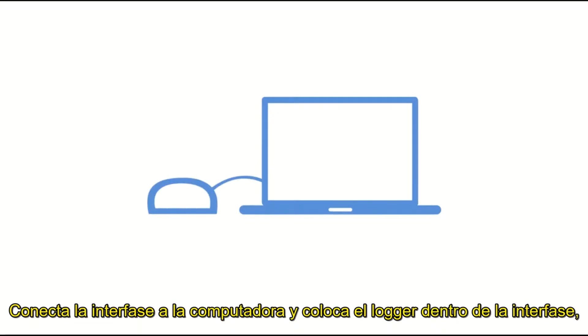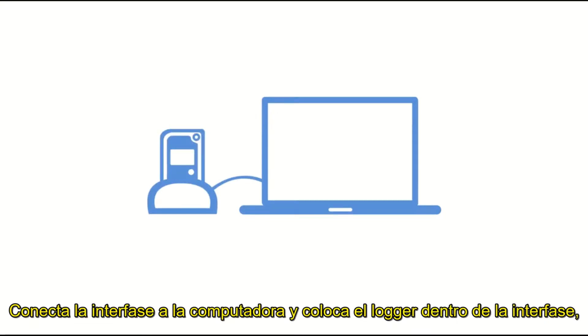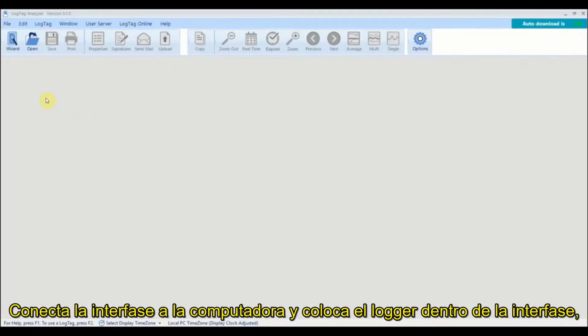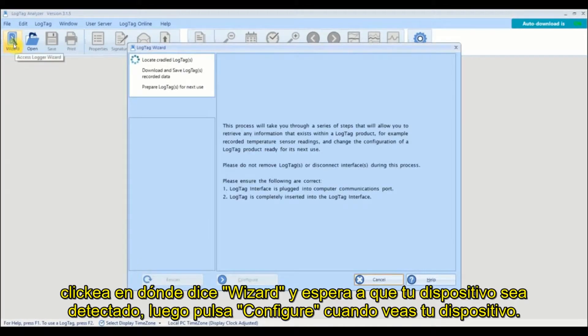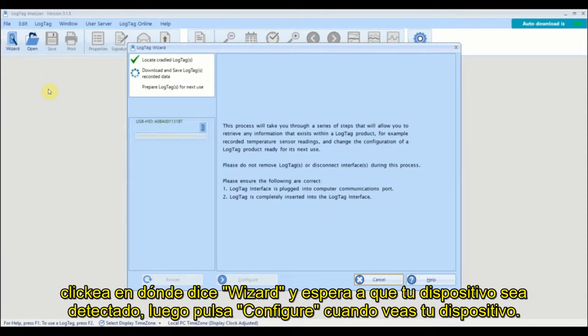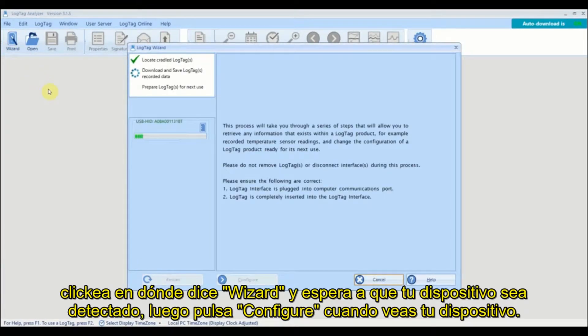Connect your interface cradle to your computer and place the logger into the cradle. Click on the wizard icon and wait for your device to be detected. Click Configure once you see your device.